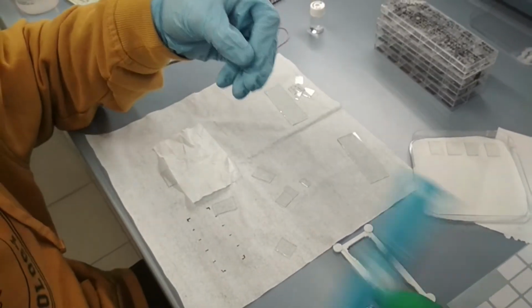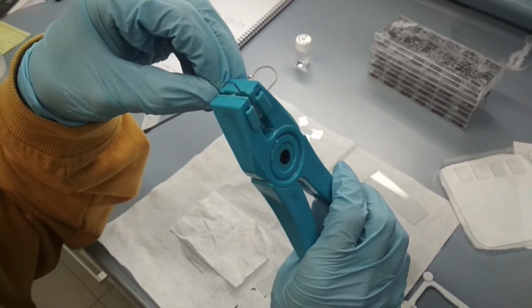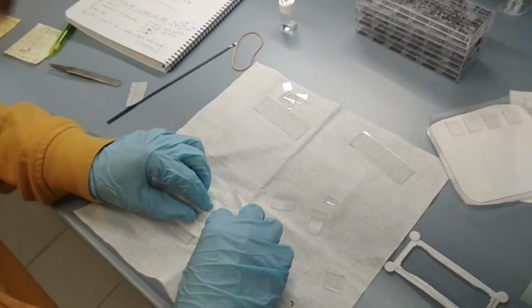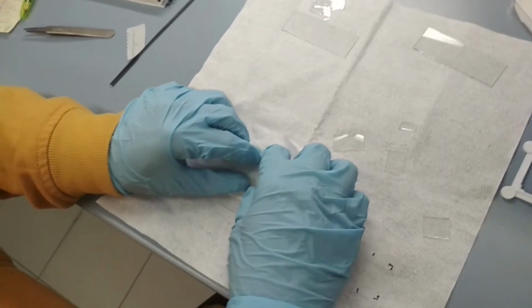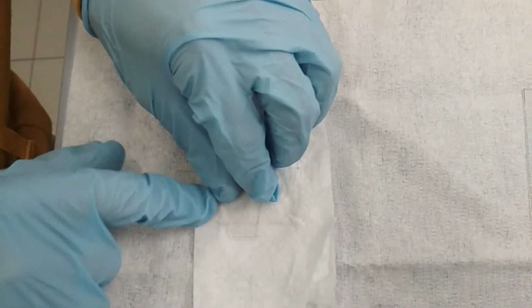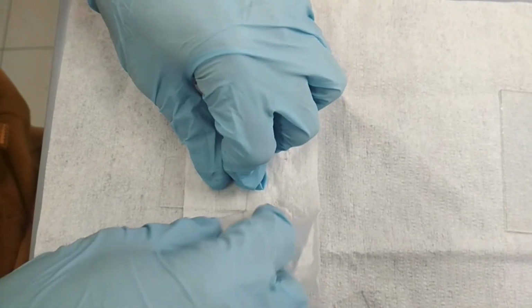Because they don't fit here, so if I put them here, it doesn't work well. But I can do it with just a piece of glass, so you put the mark slightly offset from this side, and with a little bit of pressure, you can.